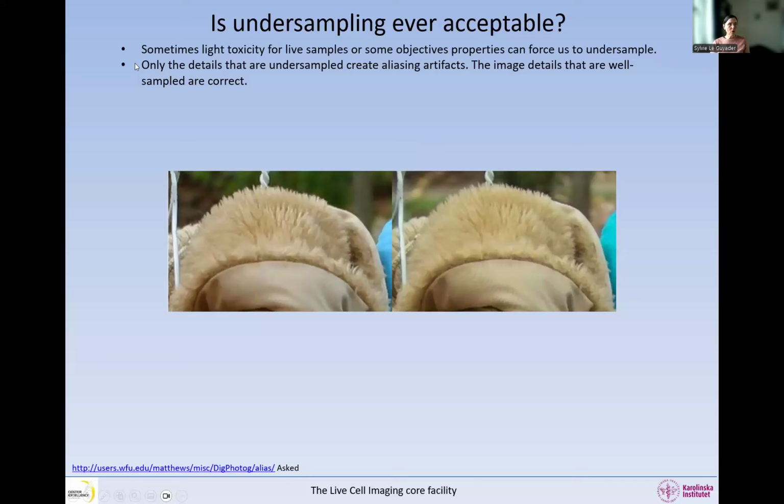You need to realize that only the details that are undersampled create the aliasing artifacts. So the details that are undersampled are resolved by the objective, but not resolved by the digitalization. So the image details that are well sampled are correct. So within one image, we will have some areas that do not create artifacts and some areas that will create artifacts. So you can see in this image that we have some coarse hair in here. And these are well sampled. So we do not need a fine digital resolution for these.